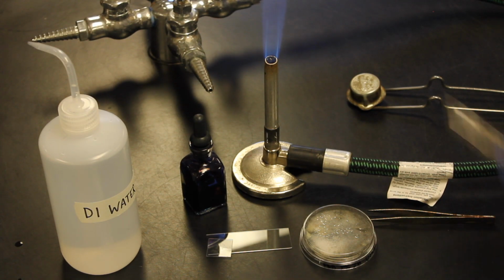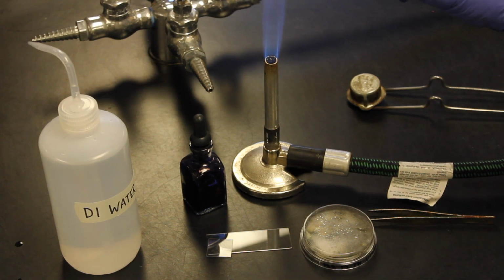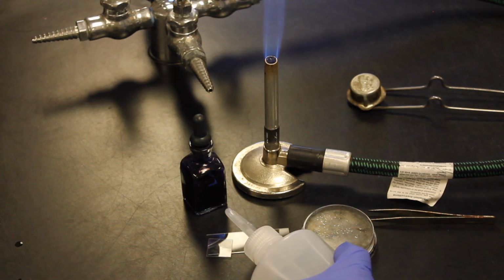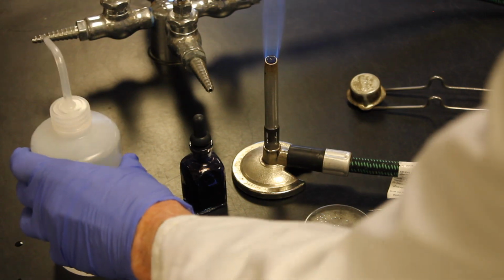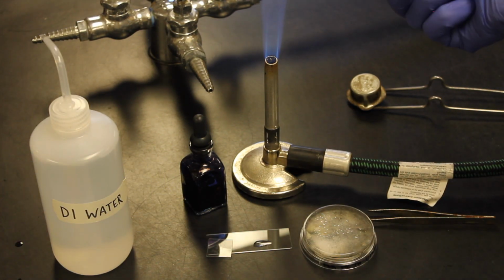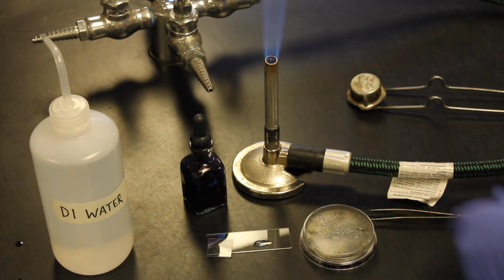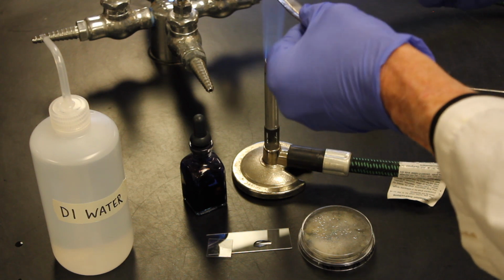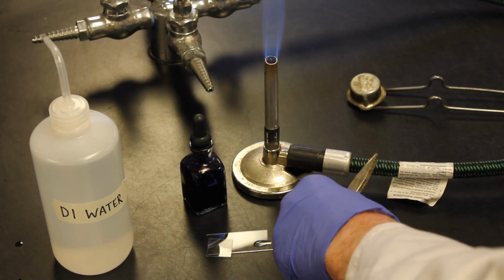Right? So what I want to do is I basically want to make a wet mount. So I'm going to put a drop of water right on top of this microscope slide. There'll be a little bit more water than what we did for the bacteria because we were making a wet mount this time. We'll heat this up. I'll heat up my other set of tweezers here so that our tweezers are ready to go.